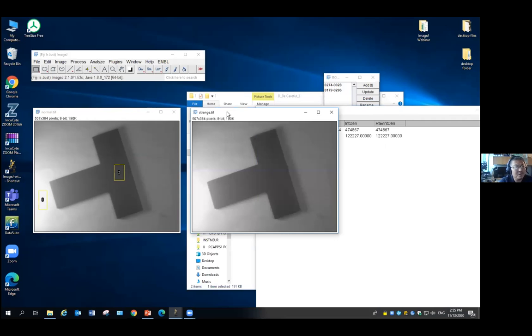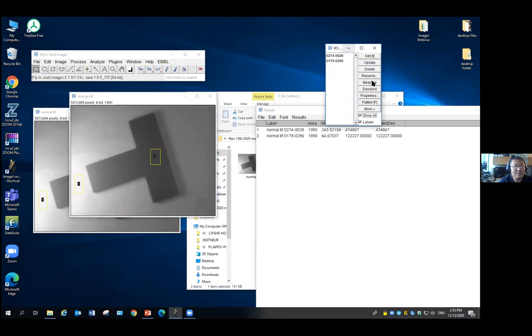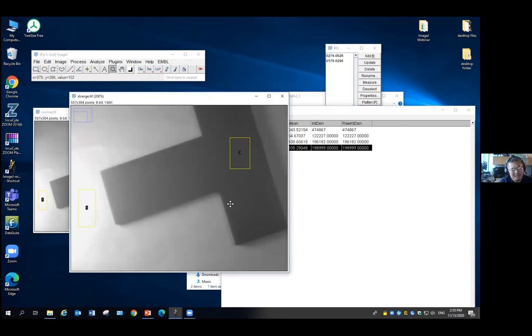But then if I go to the strange one, I highlight both. Now I do the measurement. Now you'll be able to see. This is the bright part. This is the black part. The black part actually has a higher intensity value than the white region. Okay? And that is very strange, okay? When you first see that.